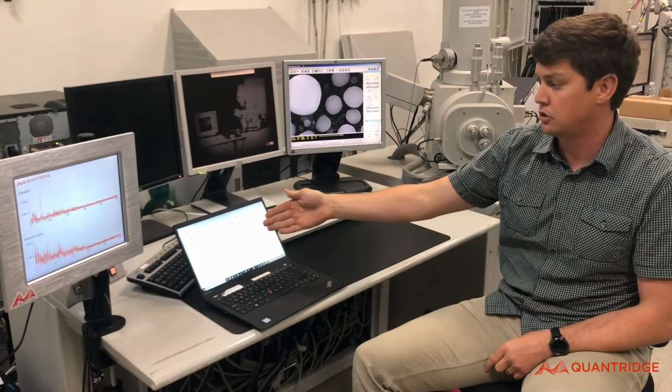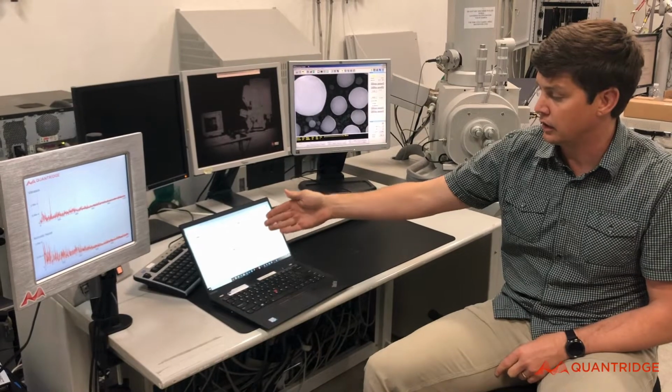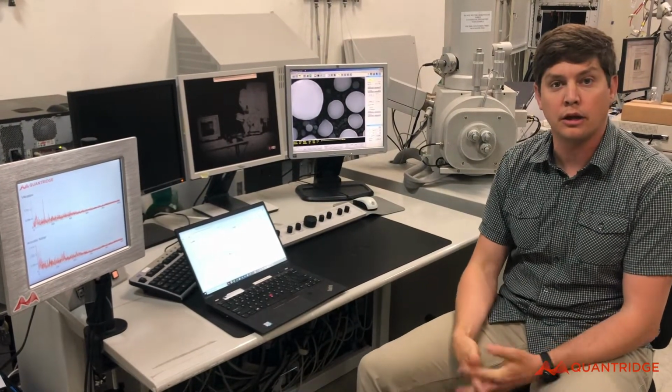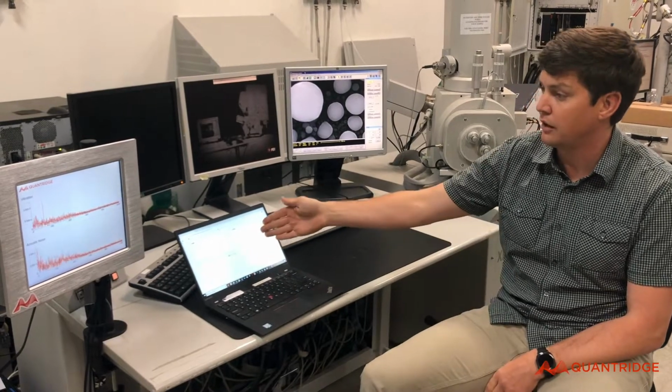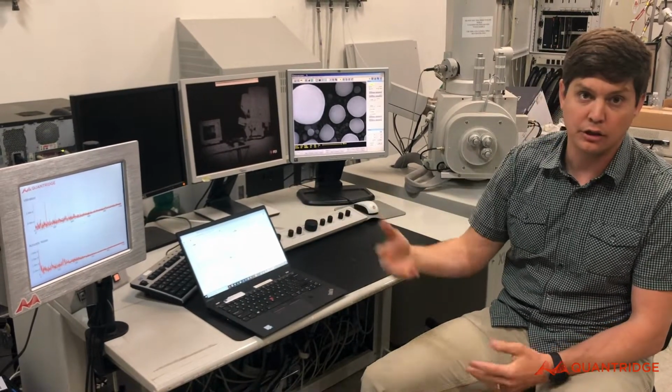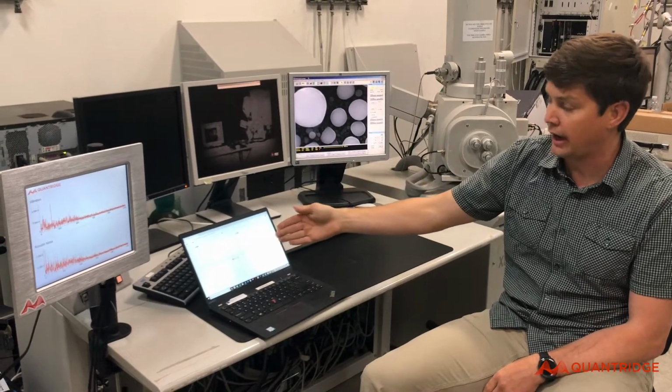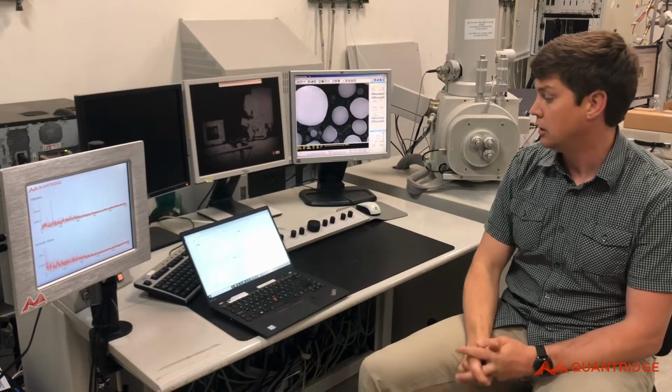on the cloud-based solution. And I want to reiterate that this cloud-based solution will work anywhere in the world with internet access. The data we're seeing here is being streamed via the 4G LTE network to the cloud, and then I'm accessing it via a local internet connection. So here we go.